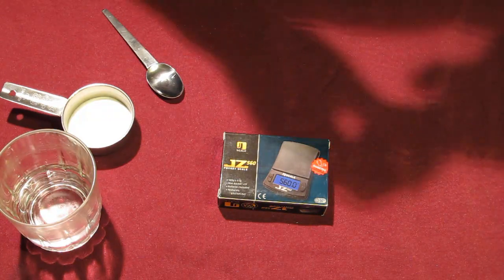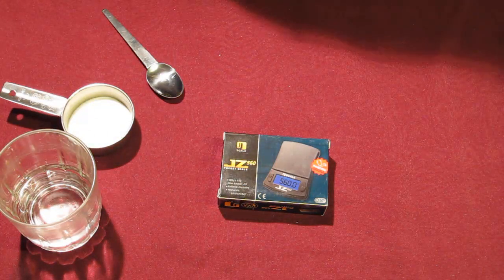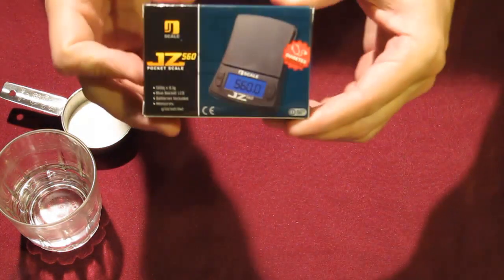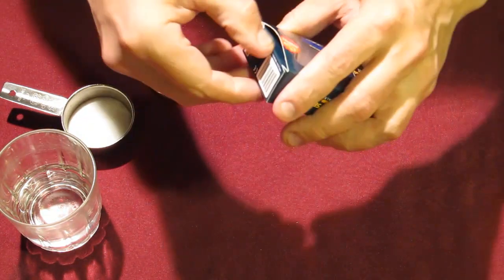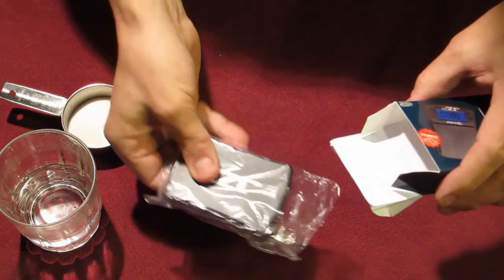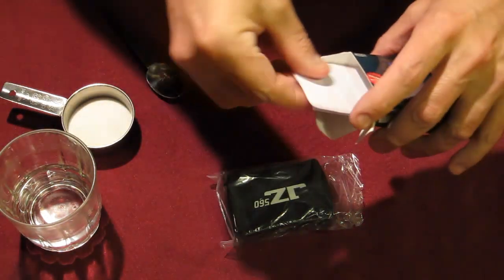The purpose of this video is to show you how to use your precision digital scale to measure DCA. Your scale will arrive in a box — they're all brand new. Simply open the box and remove your scale. There's also an instruction manual that comes with it that you may want to refer to if you have any questions.